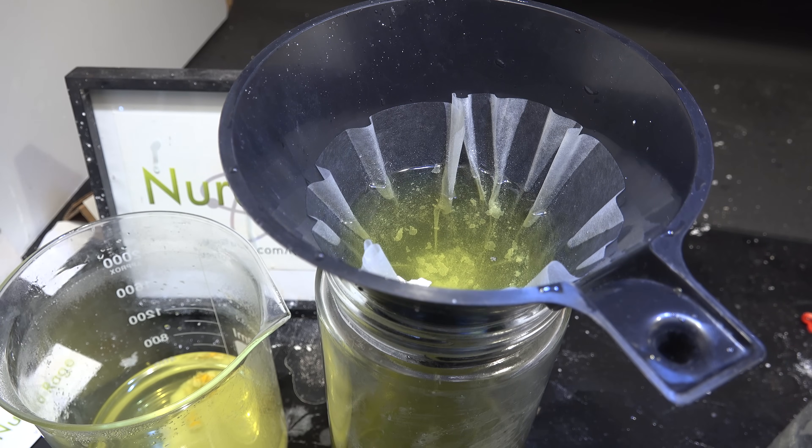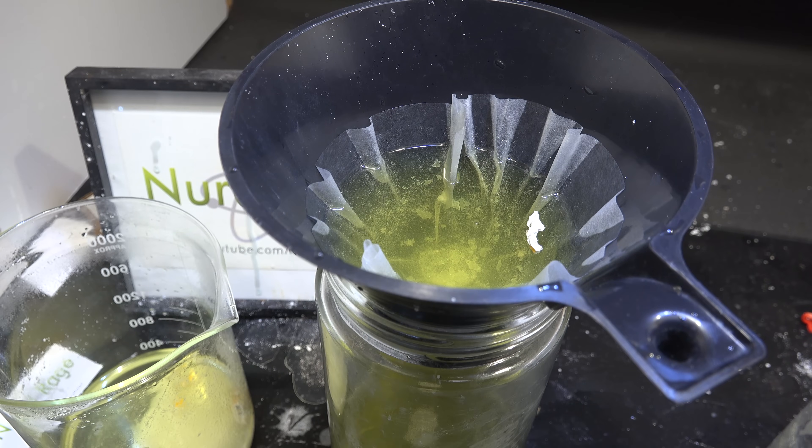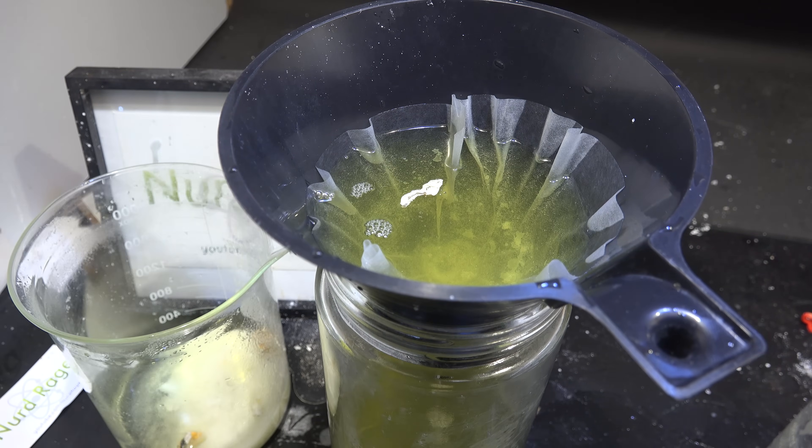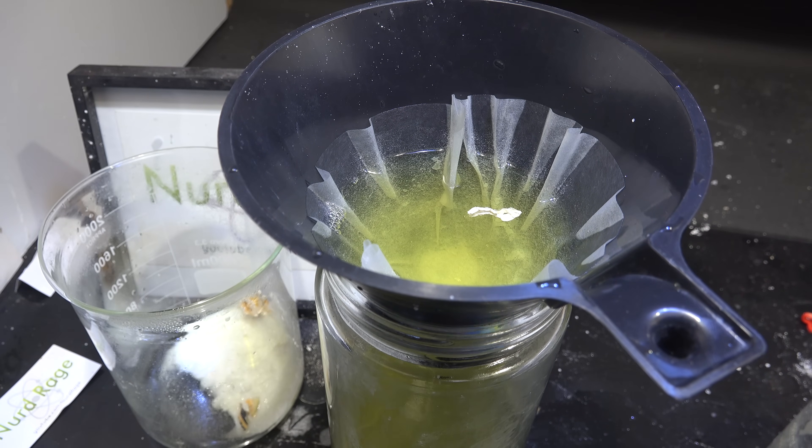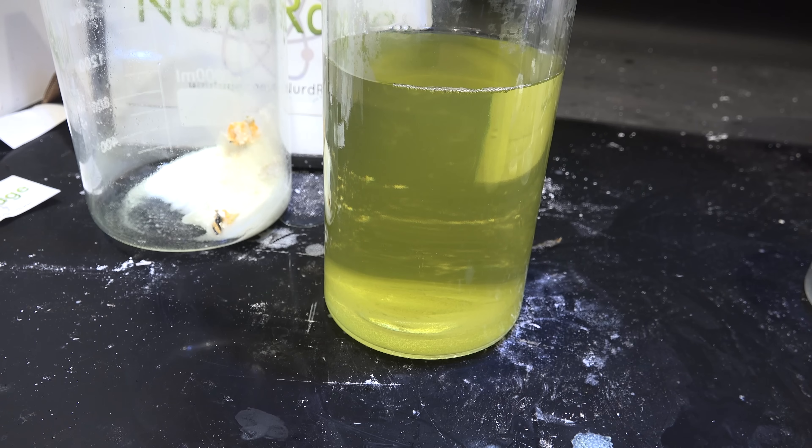Now filter out the mixture. This is to get rid of the crystallized salts and also get rid of the various paint chips that came with the aluminum softball bat we originally performed our experiment on. And here we have it, a solution of aluminum and gallium chlorides.